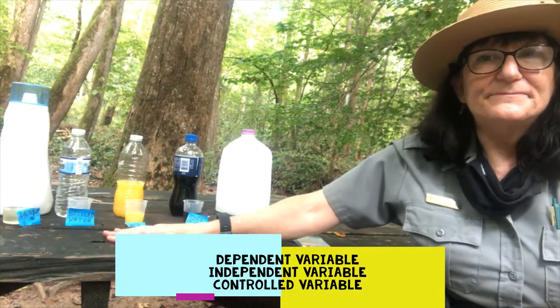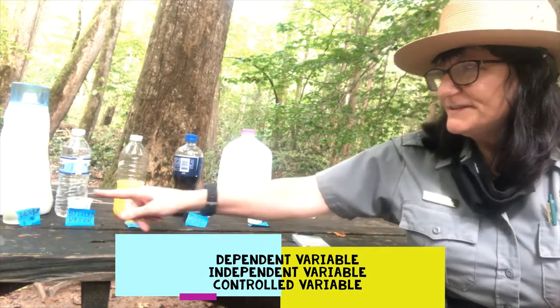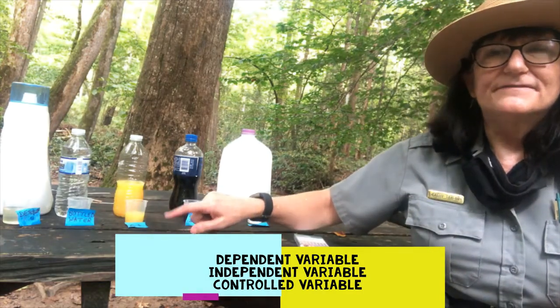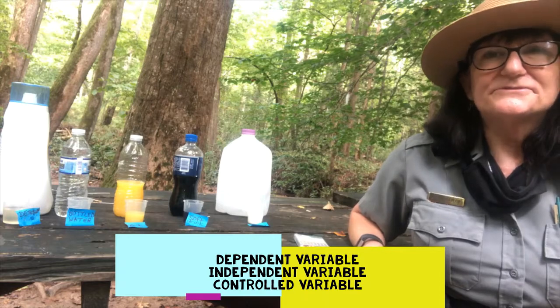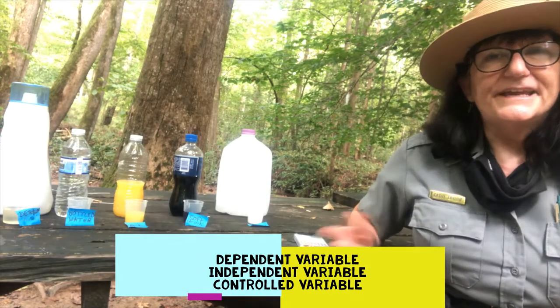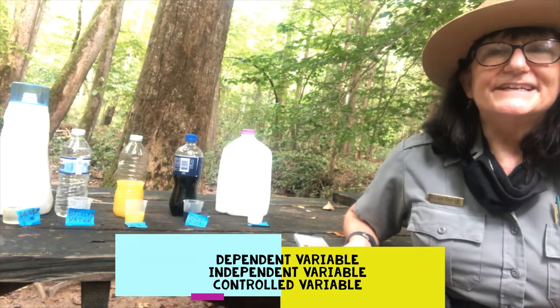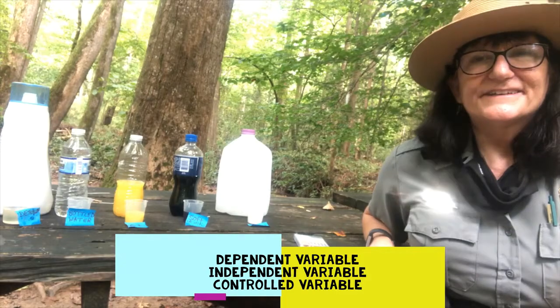The liquid is independent. And as for controlled variable, we're using 50 milliliter beakers, and we put 30 milliliters of liquid in each beaker. So we have the same amount of liquid. That's the controlled variable. So we have pH as the dependent variable, the liquid itself is the independent variable, and the 30 milliliters in the beaker is the controlled variable.